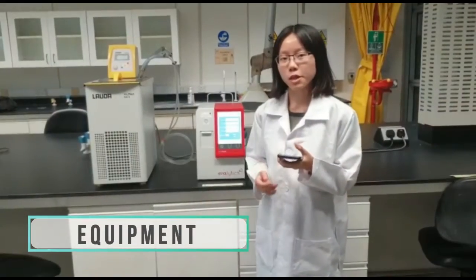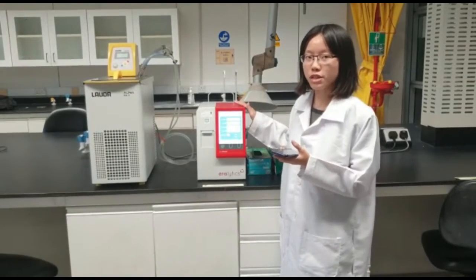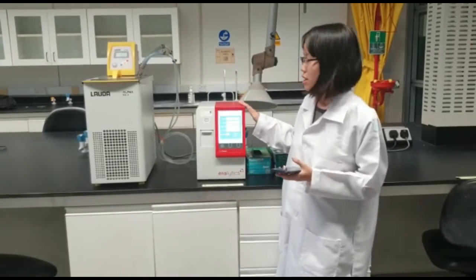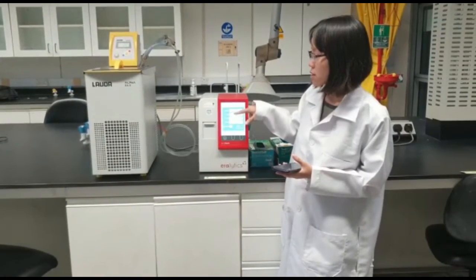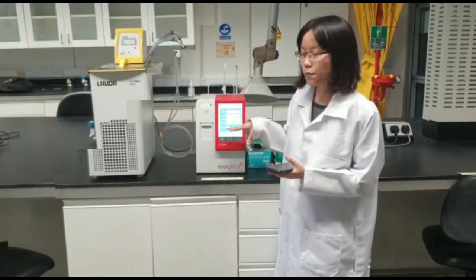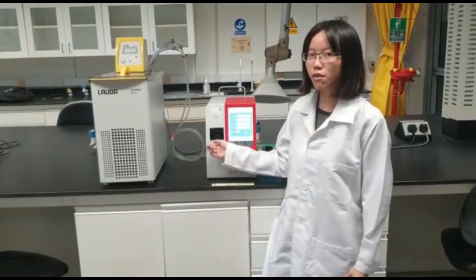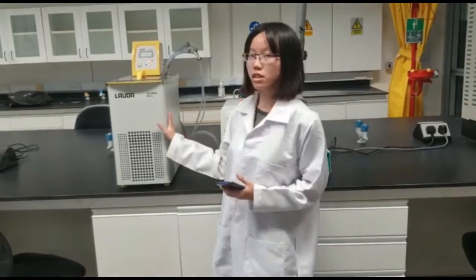Today I'll be introducing the equipment. This is a closed cup flashpoint tester called Eraflash. This is the control panel where we set the standard profile, sample ID, and the expected flashpoint value. This is the chamber where we put our sample in the cup, and this is our heater or cooler.